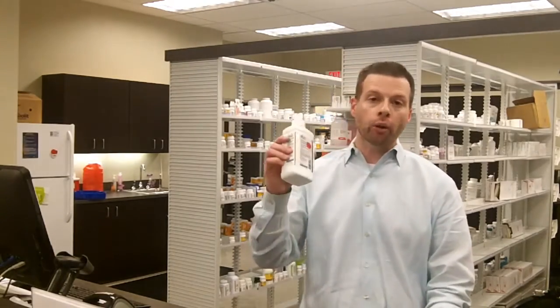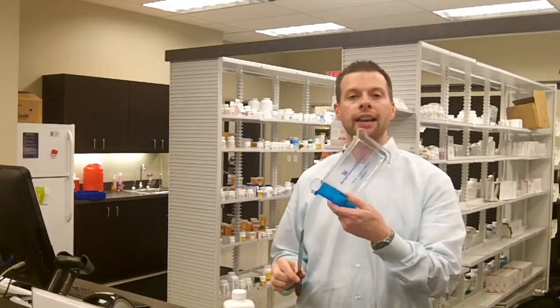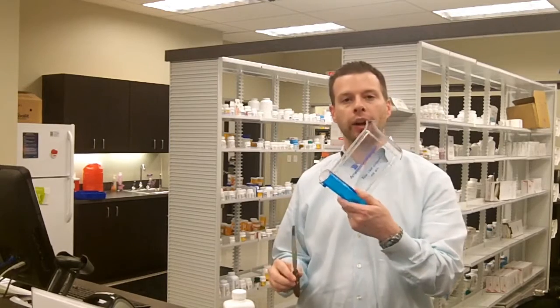Today we're going to learn about counting solid tablet medications as well as pouring liquid medications. To count these solid medications you will need to use a spatula as well as a pill counting tray.